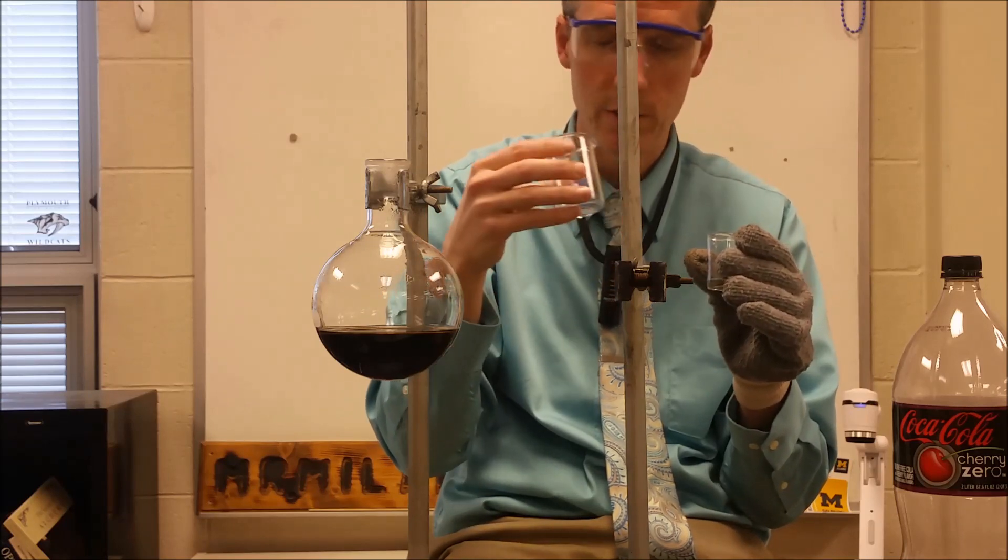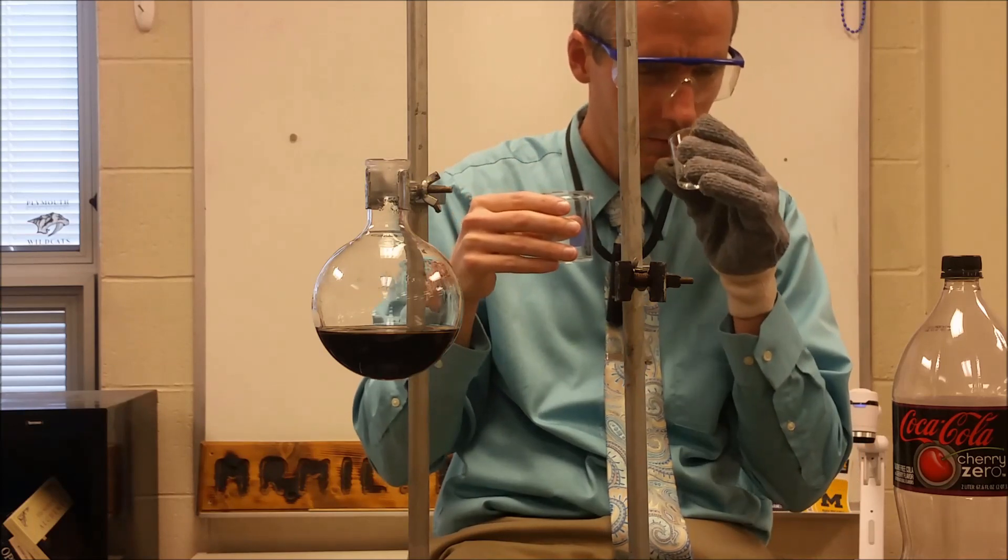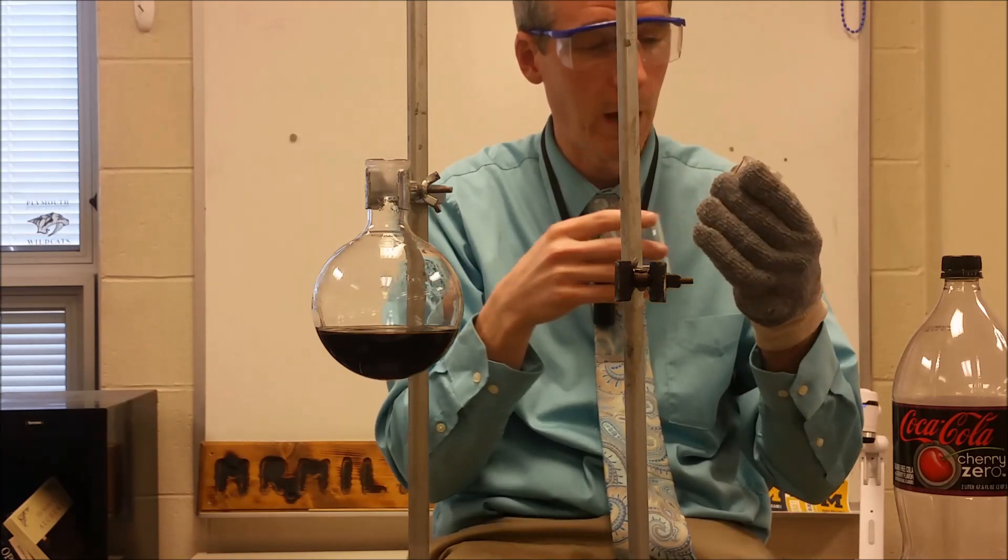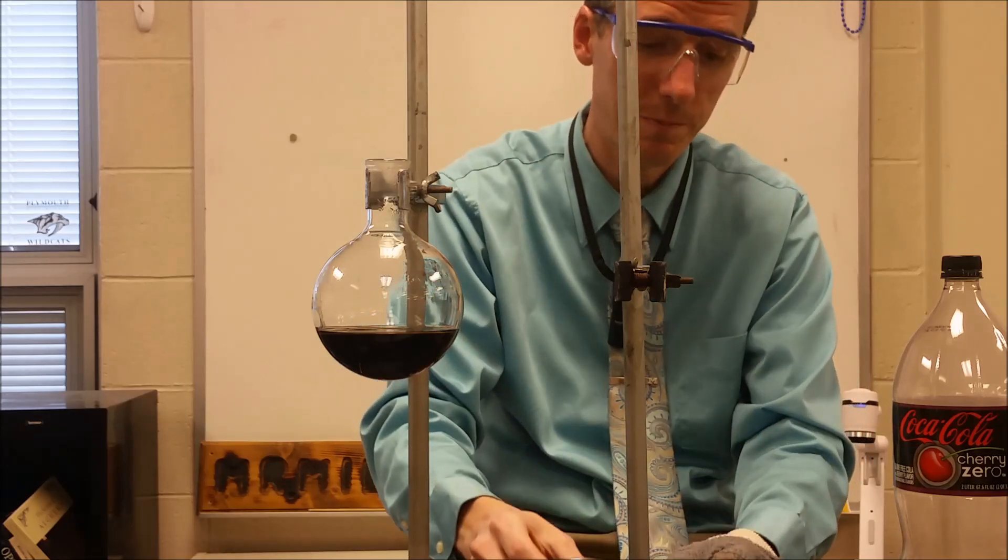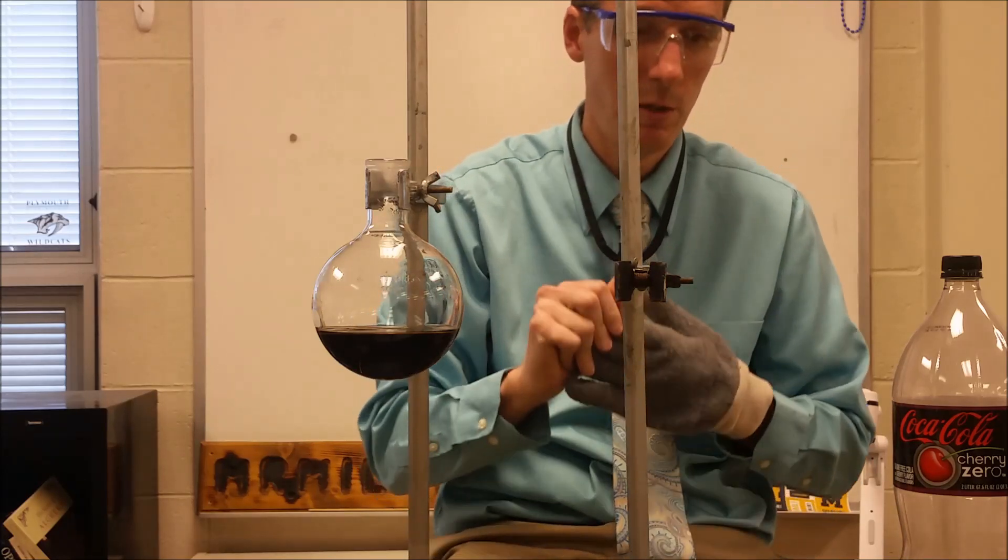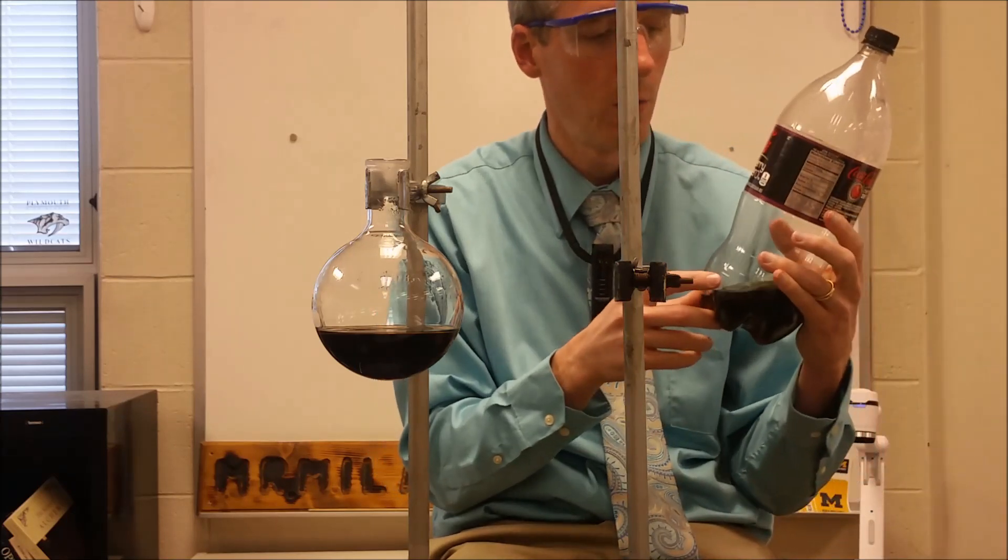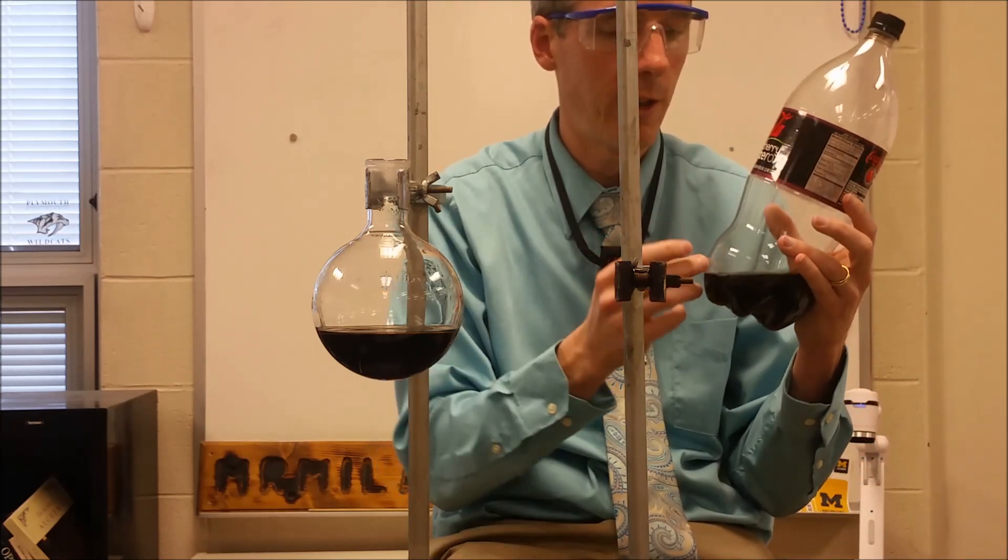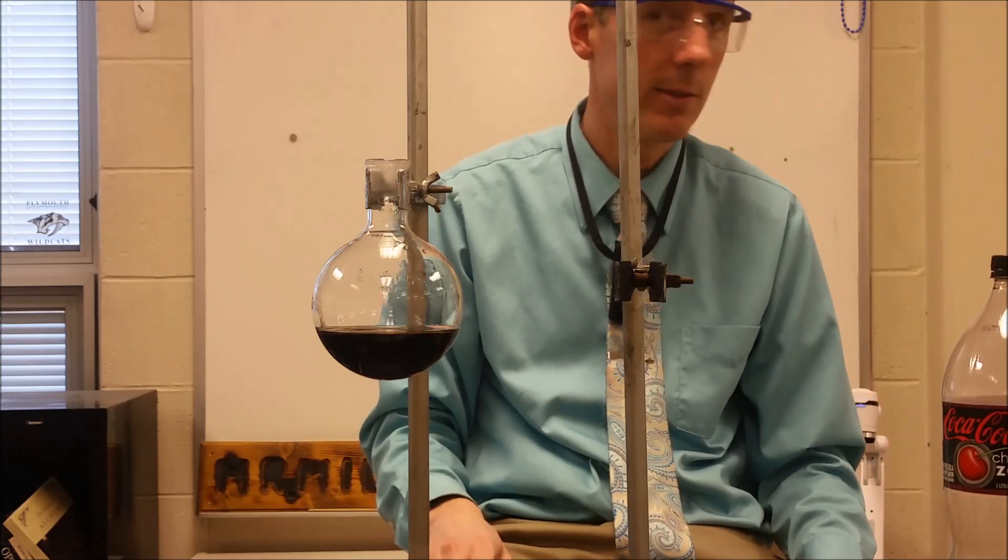And I actually smell it more in this one. It's a slightly bigger surface. But this one's also a little warmer. But they smell very similar and similar in amount, not just what chemical but how much. So potentially you would think that this would have a little bit less cherry syrup if they have to worry about calories being added to this. But it doesn't appear that that's the case.